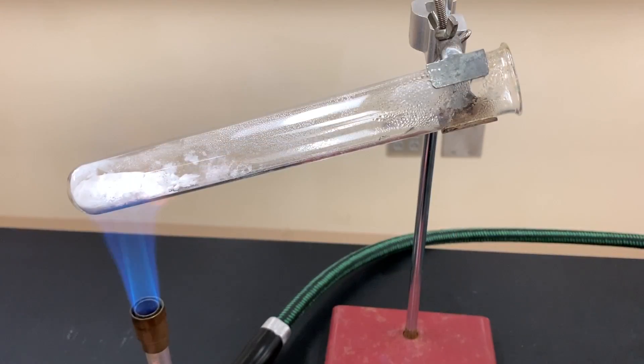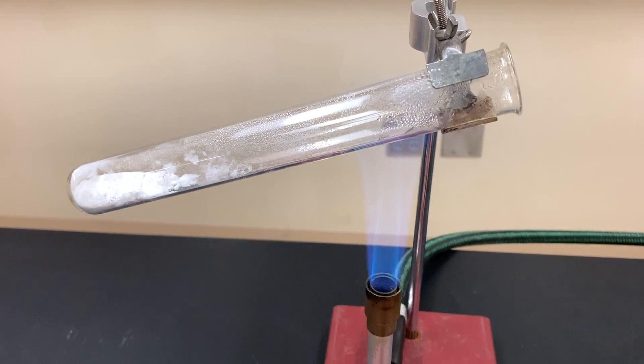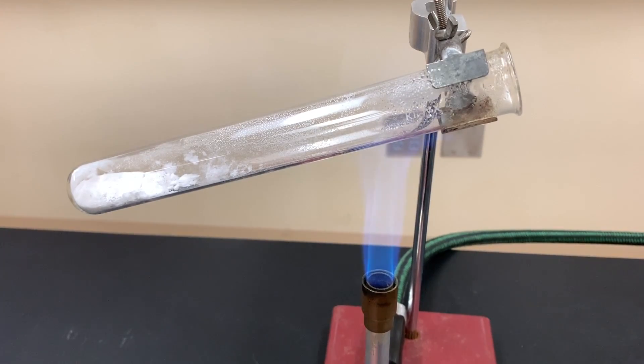I wanted you to see partway through the heating what it looked like for me to heat kind of the upper portion of this test tube. I'm going to move up the test tube so you can see that that definitely seems to look like water and you can watch that water boiling from a liquid phase into the gaseous phase. It's even making some noise there that you can detect.